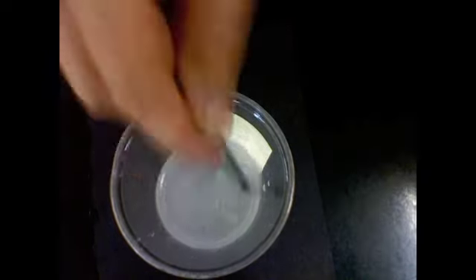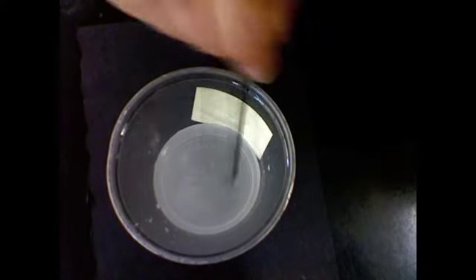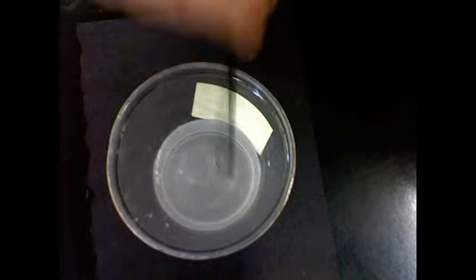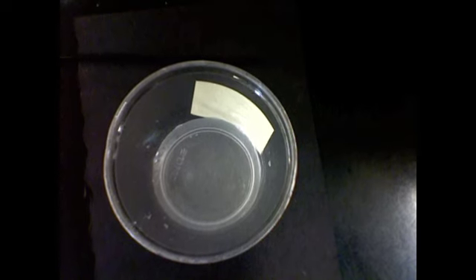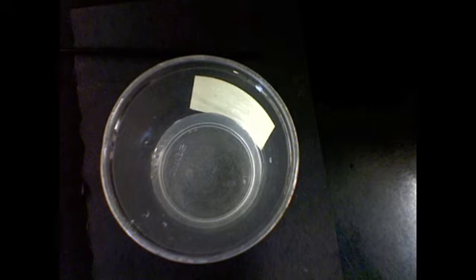And I'm noticing that I see a few particles of salt in the center, but what happened to the rest of them? Well, at this point, if this was the first time I was doing this lab, I probably wouldn't use the word dissolving. I would just notice that the salt looks like it's disappeared. I can't see it anymore. Ooh, it's clearing up. Look at that. It's kind of fun to watch. It's almost crystal clear again. So I can see the black paper straight through the water.